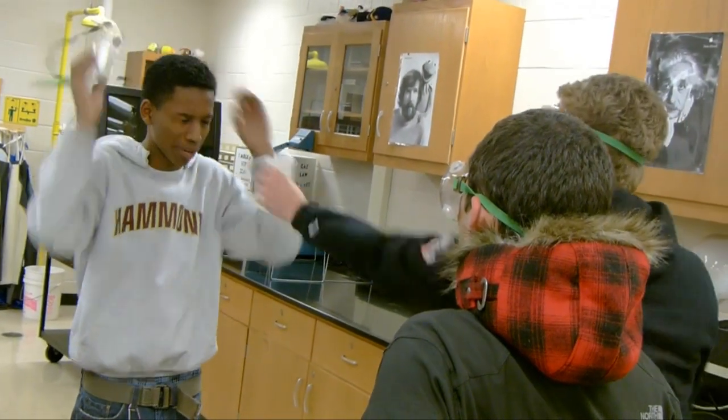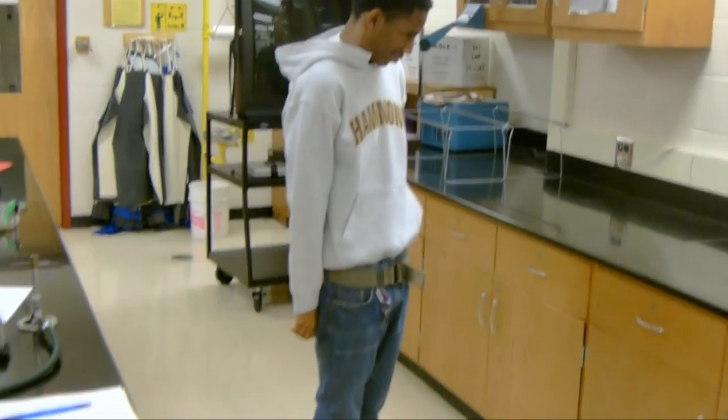Take your goggles off, right? It's just goggles. Are you gonna take your goggles off? I mean, I could, but it's just goggles. No, you won't take your goggles off. Why do I care? Like, it's goggles. Take your goggles off. Like, oh my god.